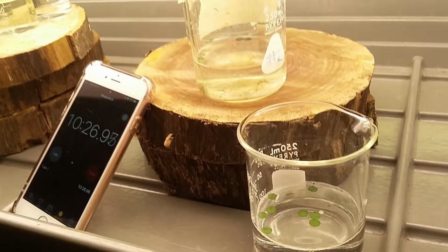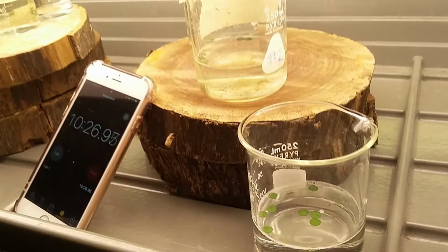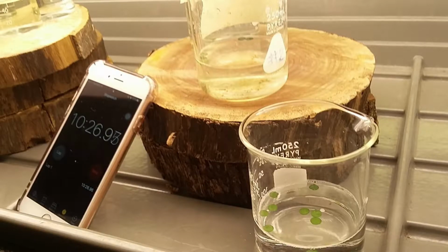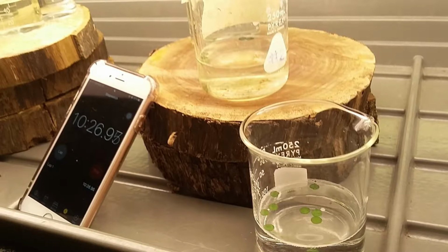One of the things to note here at this point is to watch the time between suspension of the leaf disc and transferring them to the different solutions. This is a source of experimental error because the syringes are not left in the dark and photosynthesis is still able to occur while the leaf discs are still in the syringe.